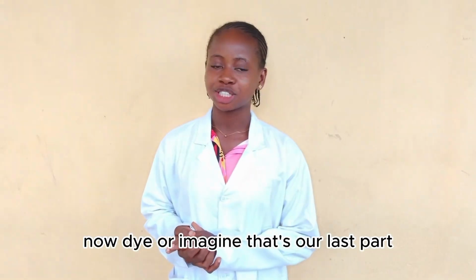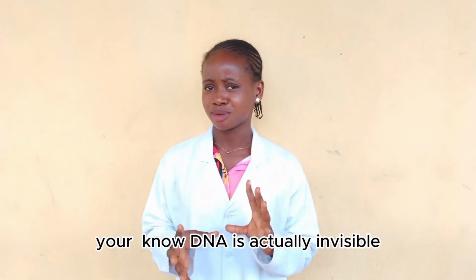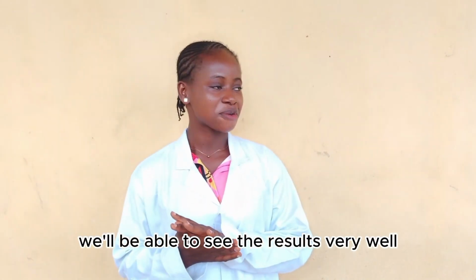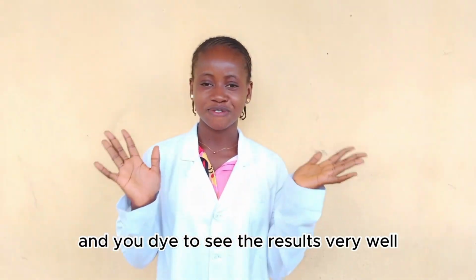Now, dye or imaging, that's our last part. Now, DNA is actually invisible. So, the dye attaches to the DNA so that when we put it under the light, we'll be able to see the results very well. So, we need gel to separate, electricity to move, and the dye to see the results very well.